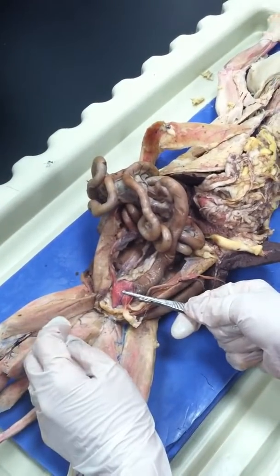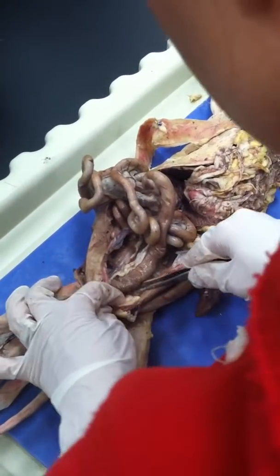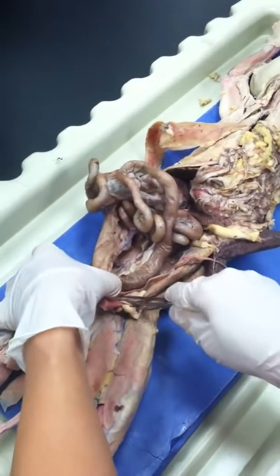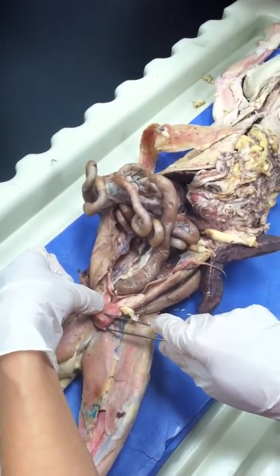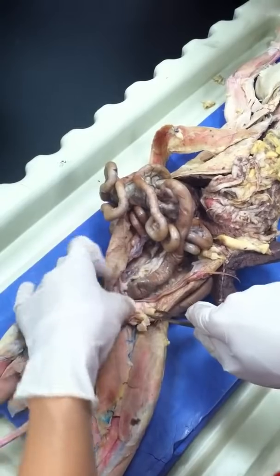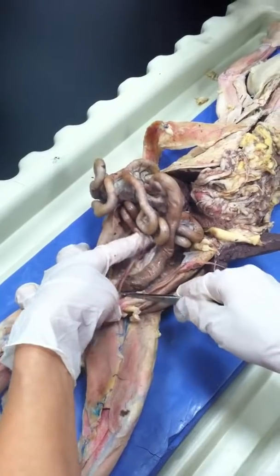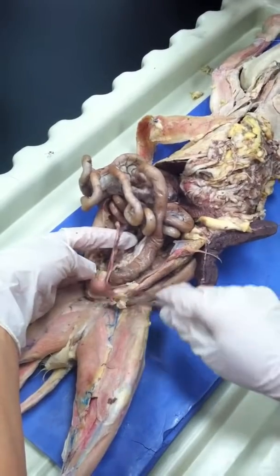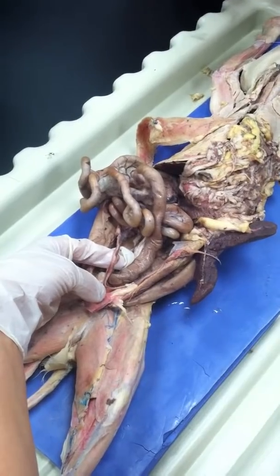Unless, because you said this is a bladder, right? Where are the ureters? Do they enter the bladder? Have you seen them? No. Under here you see, unless the bladder is this small, and then this is the uterus? We poked that one. You see, this is the uterus. Unless that could be the small one, but it's too small. We think that this is the bladder. The uterus is the end of the two tubes. So yes, this is the bladder, lower down.